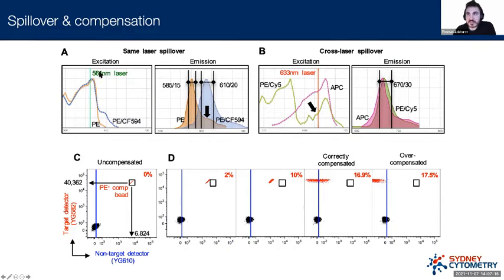In two fundamental ways, we can get problems here. The problem comes from a degree of overlap. So if we, for instance, have two fluorescent molecules that we've put on a cell via an antibody, let's say in this case PE or phycoerythrin and PECF594, which is a tandem of PE. These are two fluorophores which are both excited highly by a yellow-green laser, 561 nanometers. So this is very good. We can have these two fluorophores on a cell. We can excite them with a yellow-green laser, and we can get some signal coming off them. But if you see here, there is in fact overlap between those two signals.